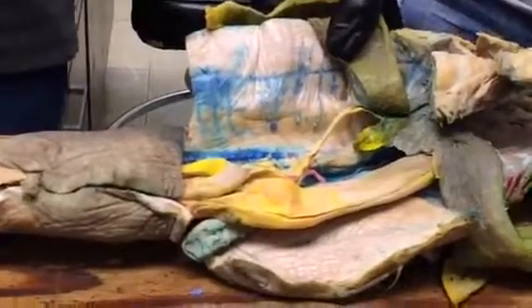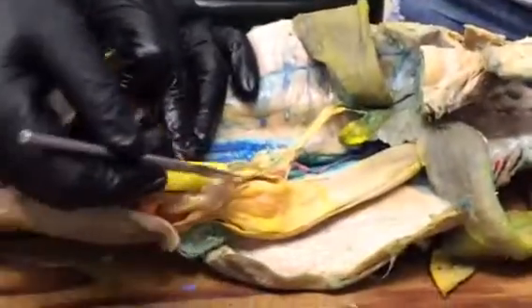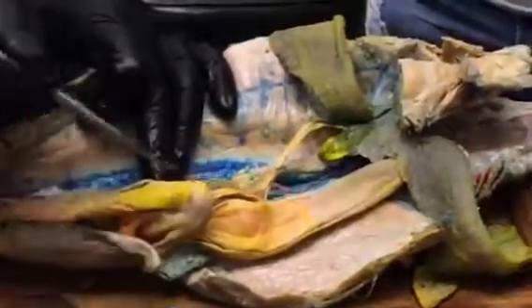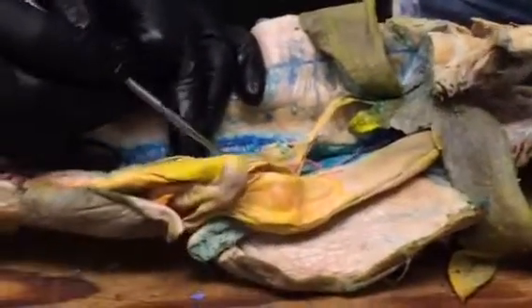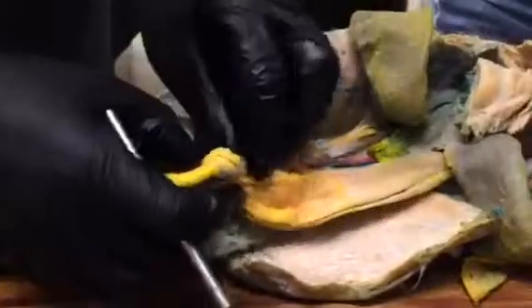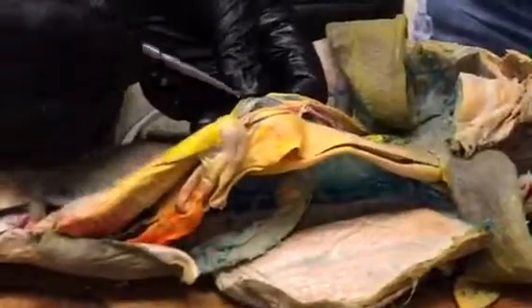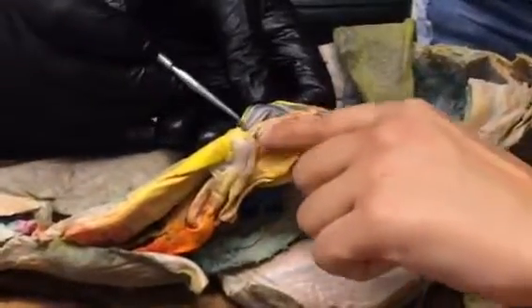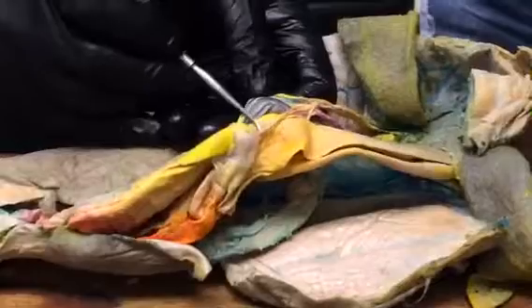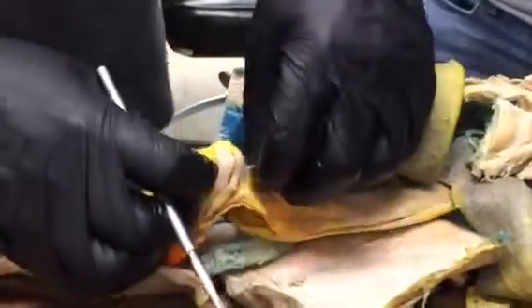Remember there was a pancreatico-mesenteric vein that's draining from the region of the ventral lobe of the pancreas back into the hepatic portal vein. And the pancreatico-mesenteric vein is running along right here. And there should be an artery running along with it. Is there anything red in there? Hopefully that's red. Oh, it's right here. Yeah, the orange one. There we go. Okay, right there. This is where you guys have the big advantage of being able to see red.